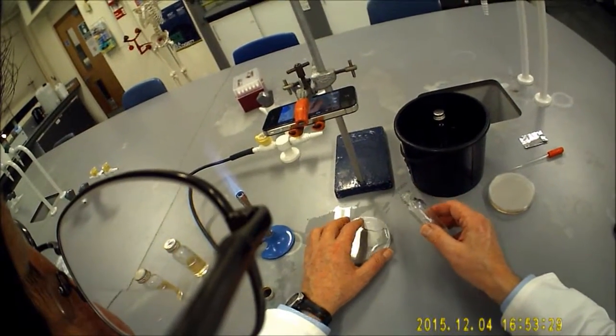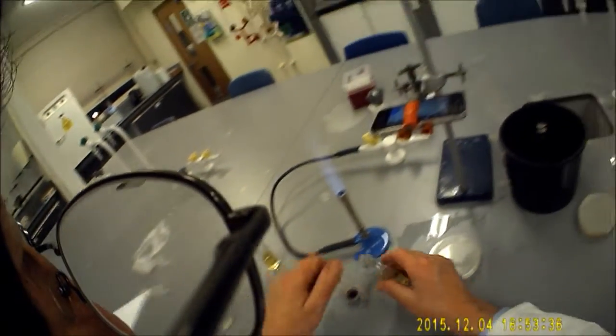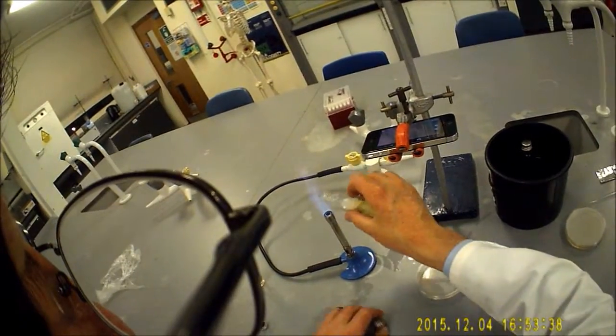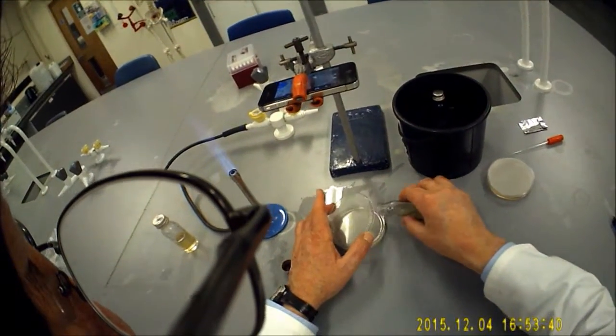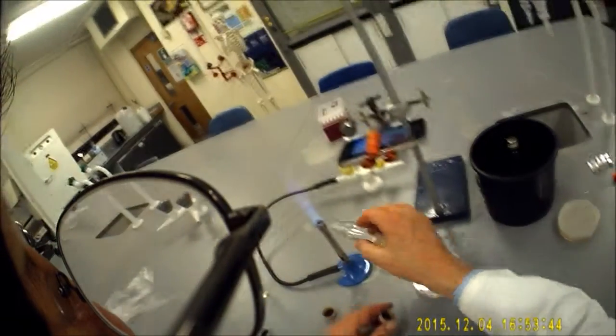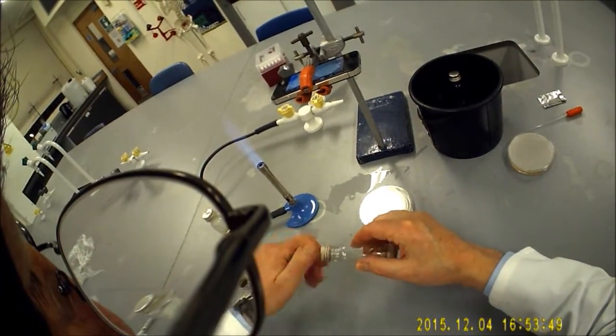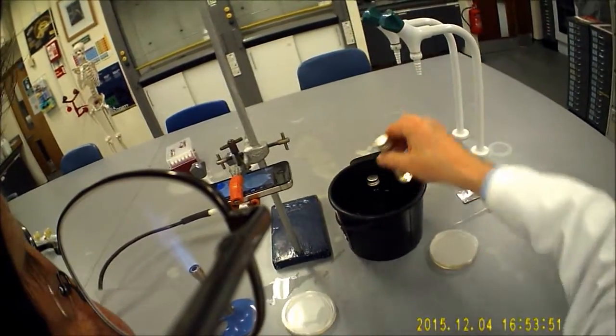We're going to put the discard pot into there. And then I'm going to take out just half of what's in this bottle. I'm going to seal it up and leave it in there.